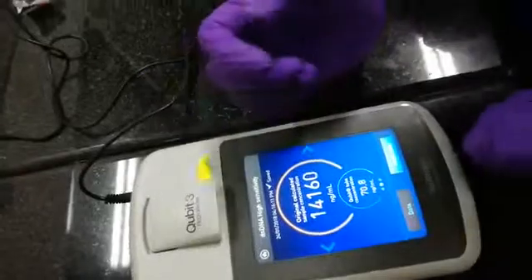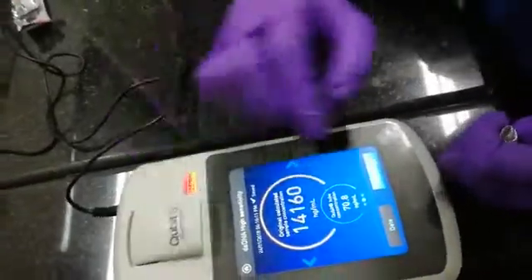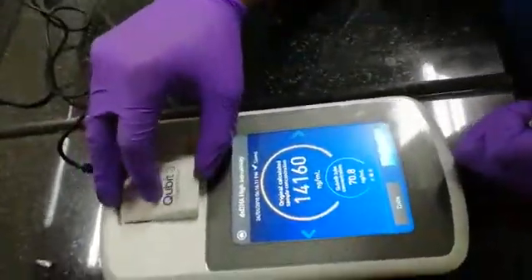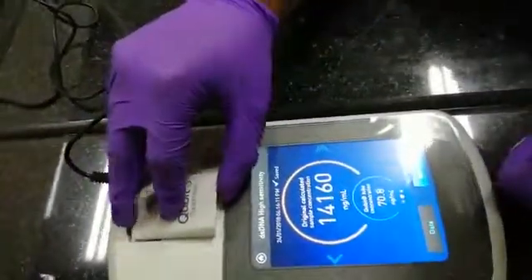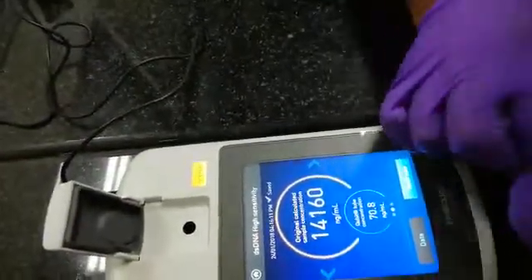Then you will get the readings. You enter the sample volume — one microliter. Then open it, put it in the dark, and read the next sample. You have two samples.